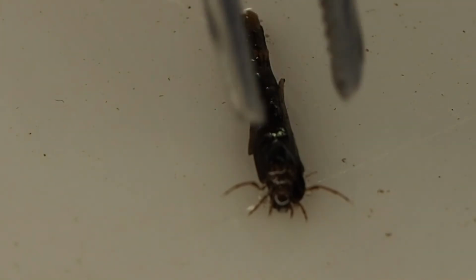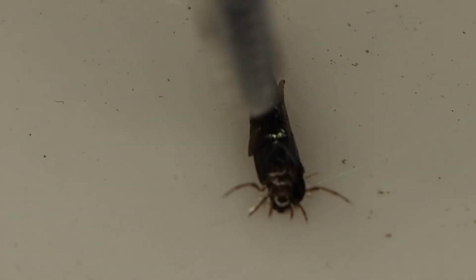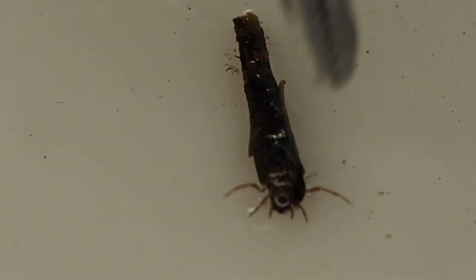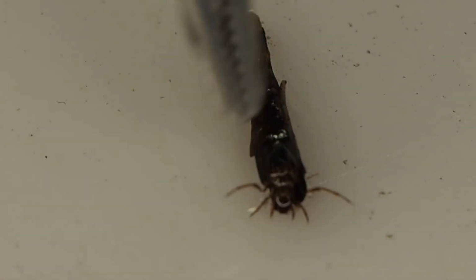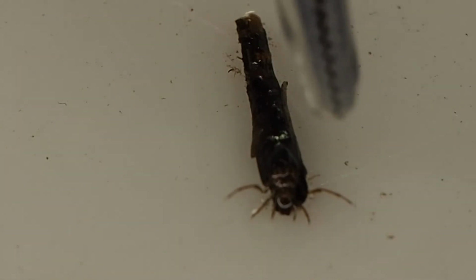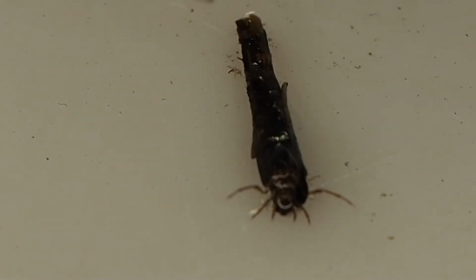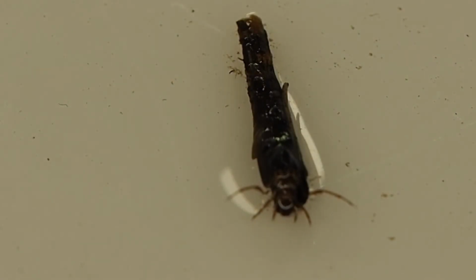So once again, we look at the feature of the casing, in this case the limbs, and so we note that the last pair of limbs are actually quite long and protruding well above the head and much longer than the other limbs in this particular individual. So we note these features, and then we're going to go to our guide. So I'm going to move that out of the way.